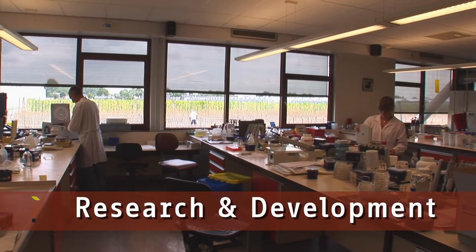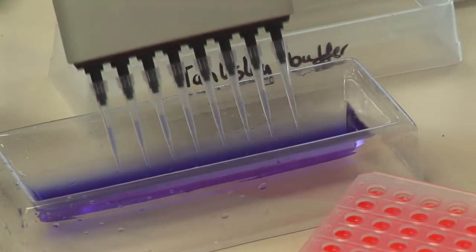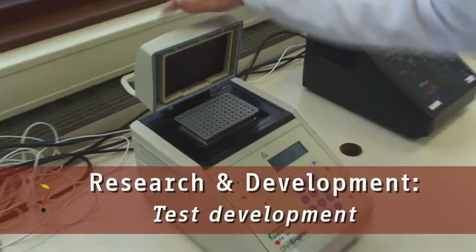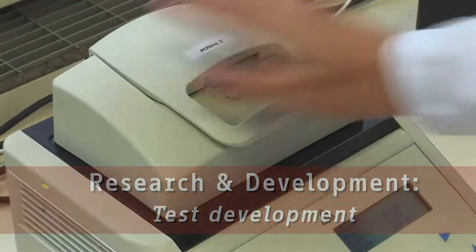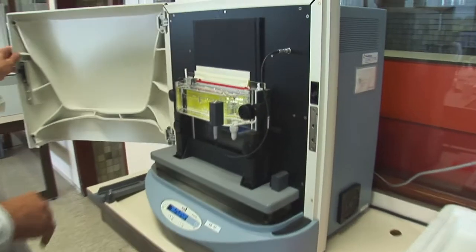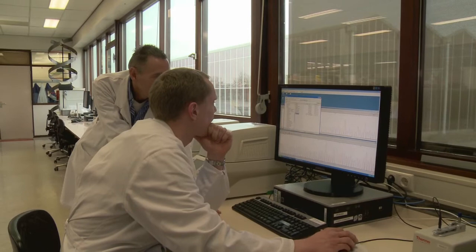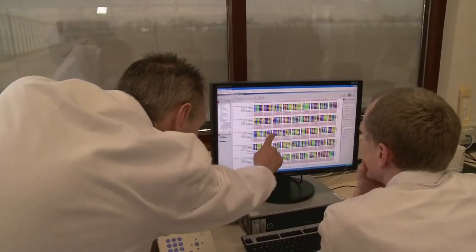Researchers at Research and Development work on the development of new and improved tests, for example when new pathogens are found. The R&D team has a continued focus to improve the routine tests. They also look at ways of translating new and often expensive scientific tests into methods that can be applied on a large scale for routine testing.